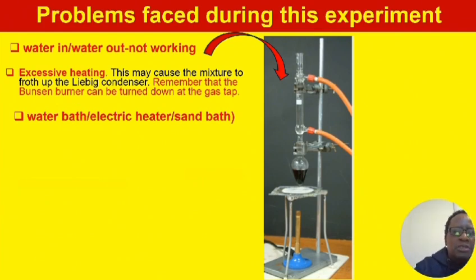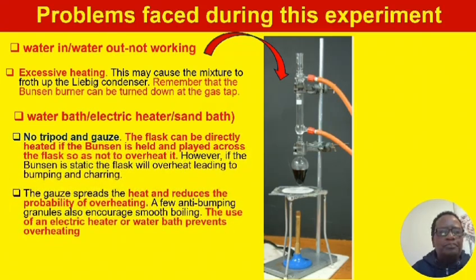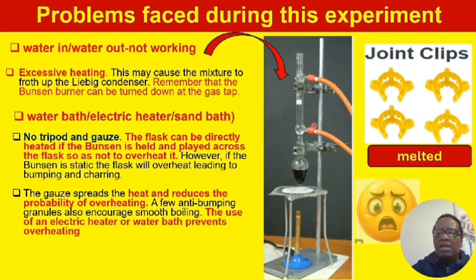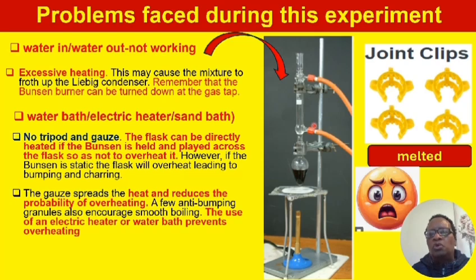The method, however, clearly said use a water bath or electric heater to avoid overheating. That could have helped. The joint clips that are used to hold the flask to the condenser melted due to overheating. That caused loads and loads of problems.